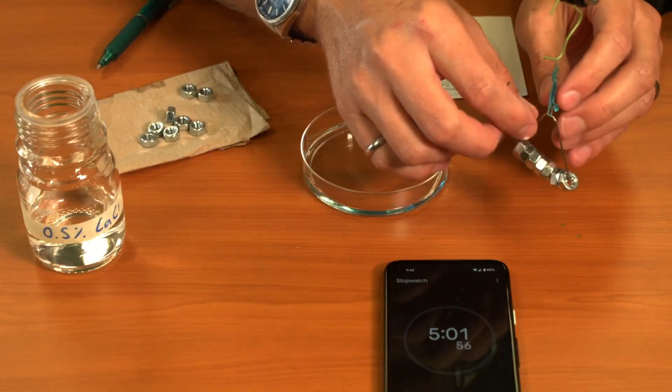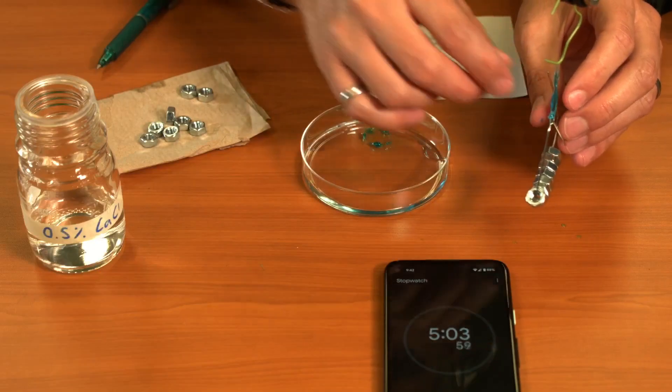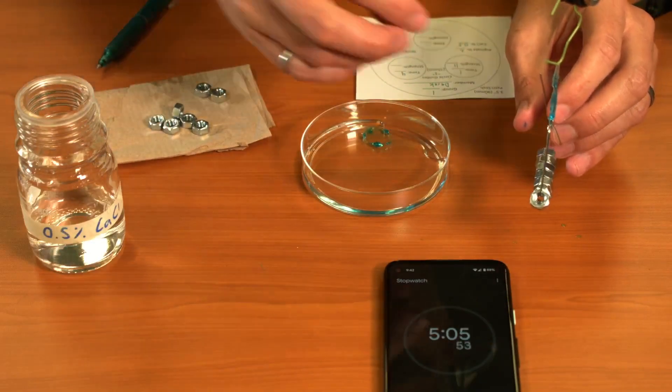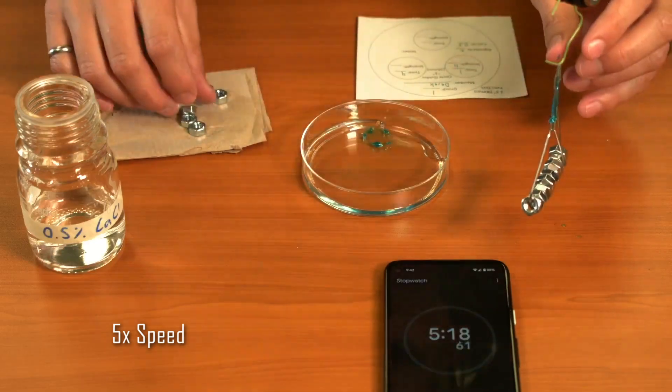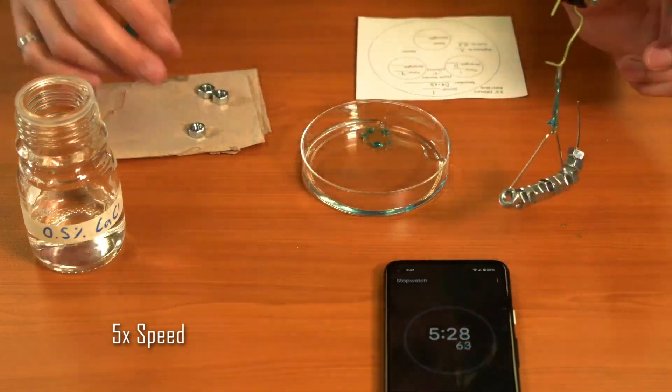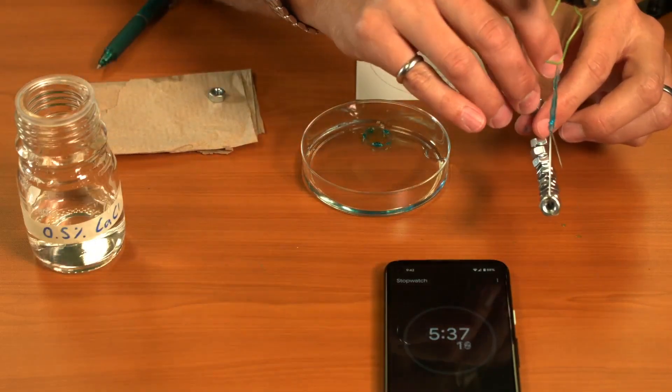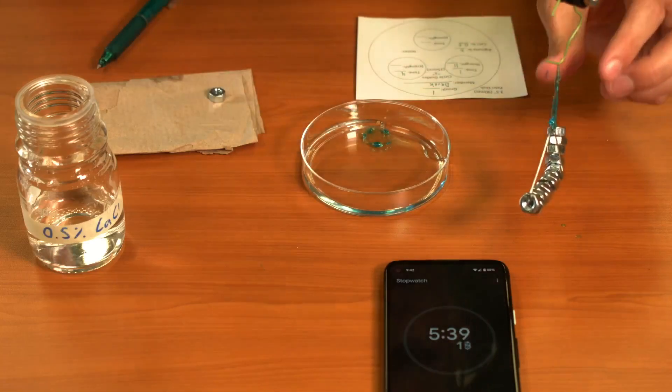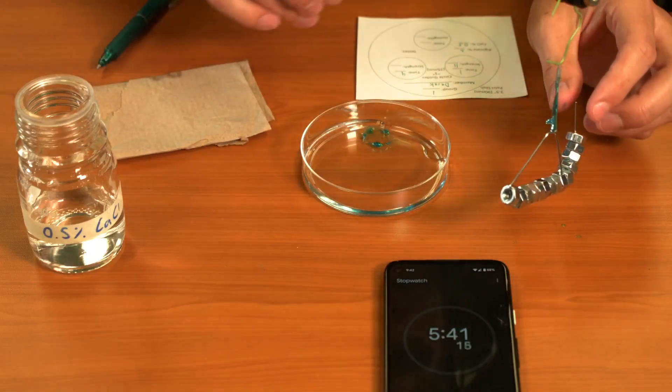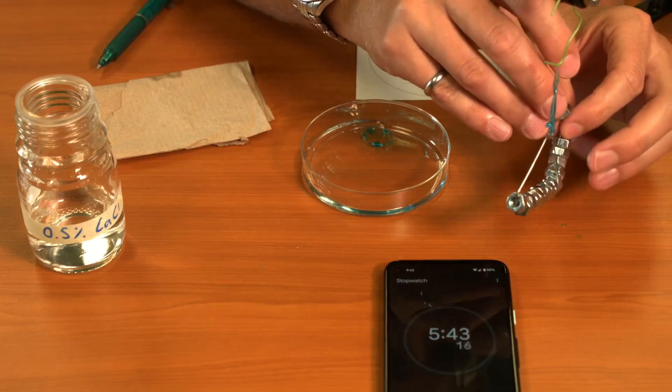Try not to let it spin too much because that will weaken it. I am pausing for just a second after adding each weight to make sure that it's stable before I add the next one.